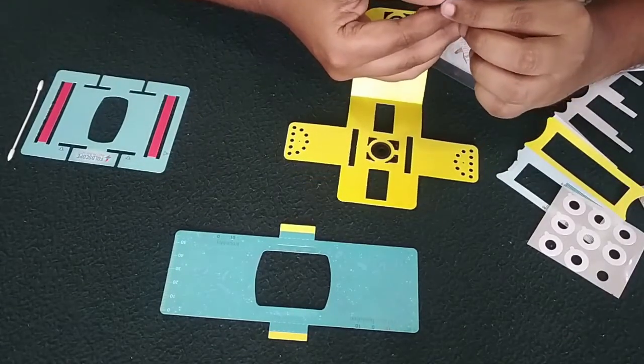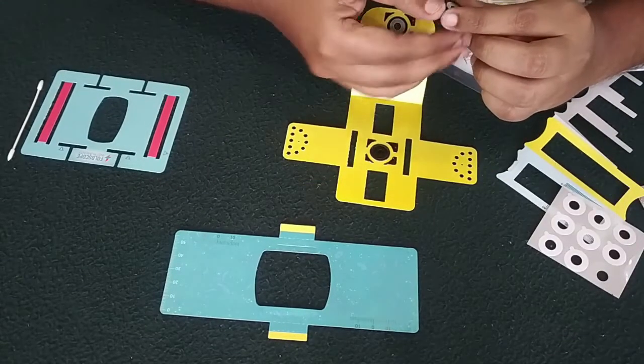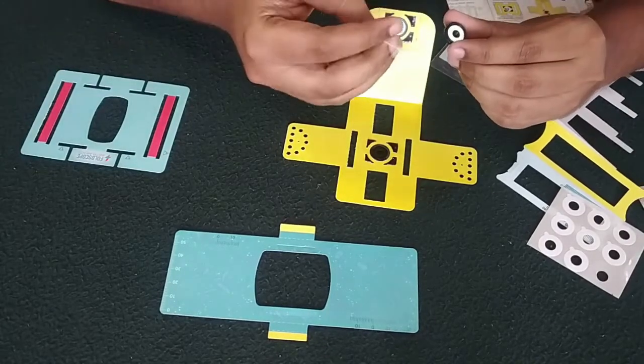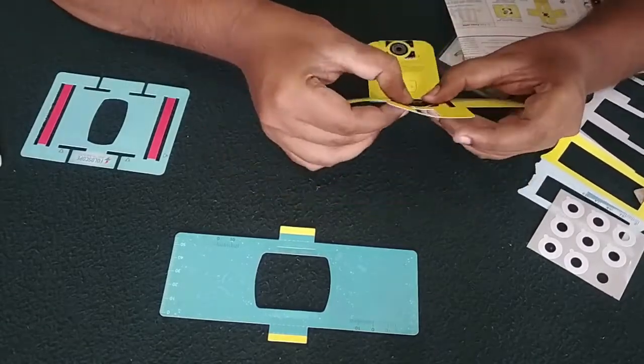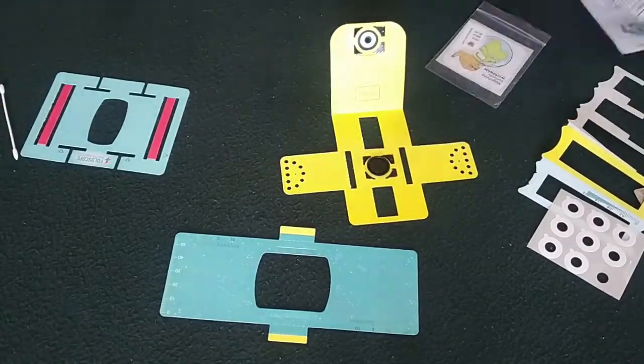Now taking this coupler, try to clean the lens.